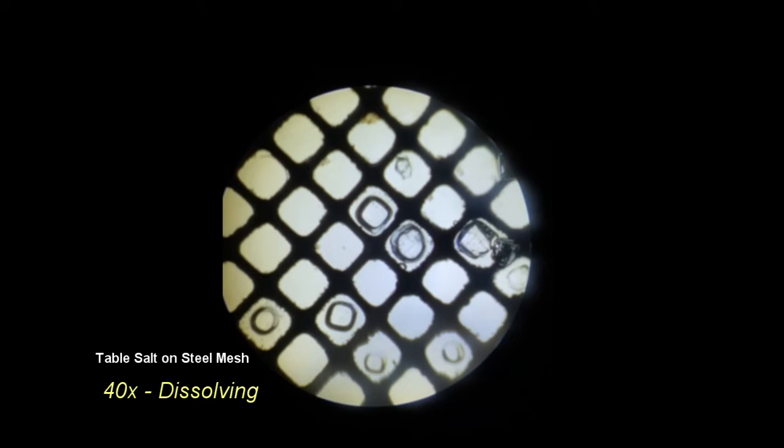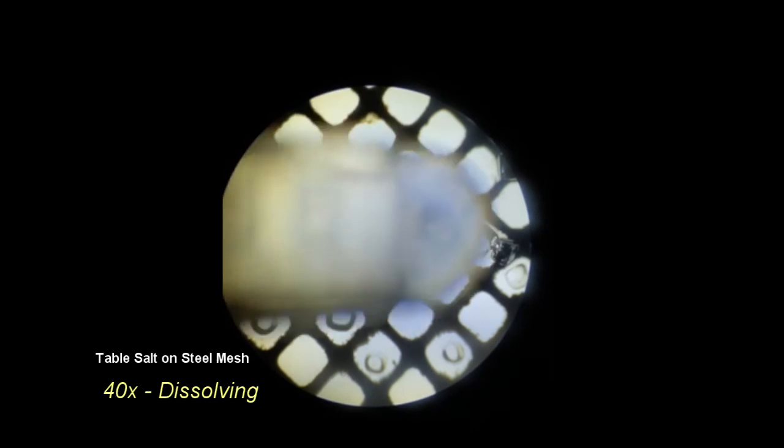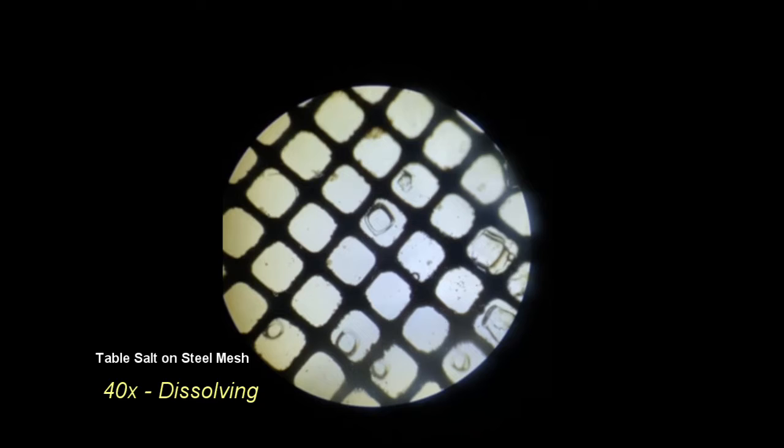In the main separating solutions lab, an additional method of filtration was used as well, a coffee filter. During microscopic examination of the coffee filter, the structure had no symmetry or measurable pores, and is a mesh of varying width fibers. For the purpose of this video, the visual effects would not have been as useful.